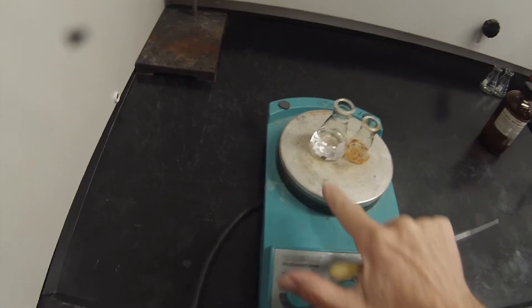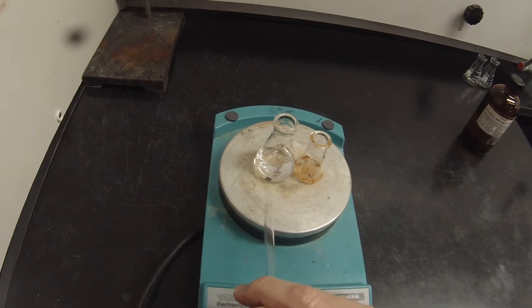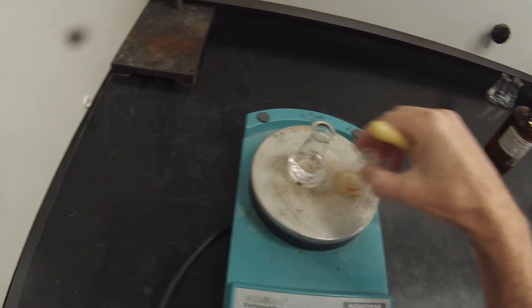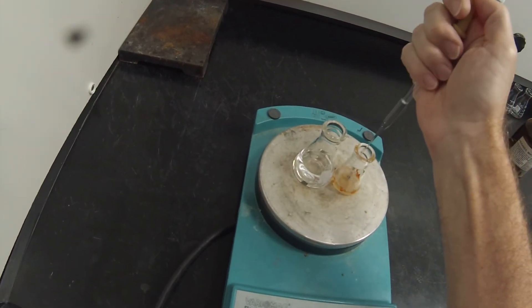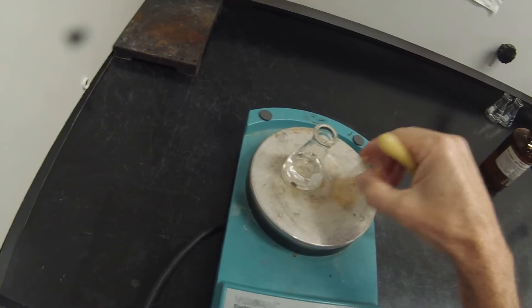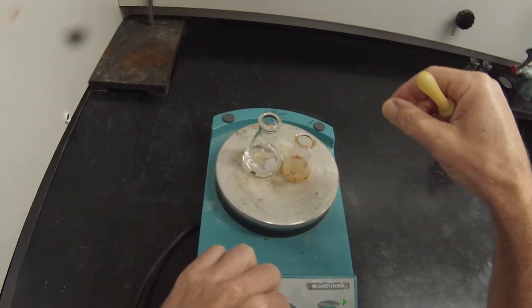You can see it's starting to bubble a little bit at the boiling stone. The boiling stone, as usual, is providing a surface for those bubbles to form so it doesn't build up too much gas and then explode out. This one's boiling nicely. Just want to swirl that around. Looks like it's going to take a couple more pipette fulls at least.